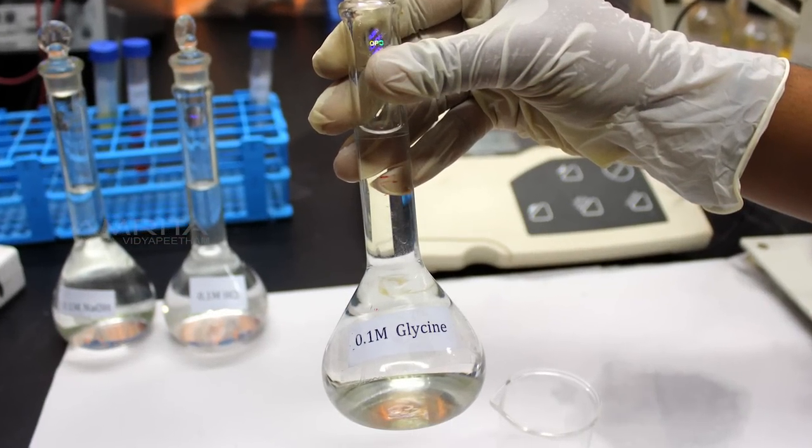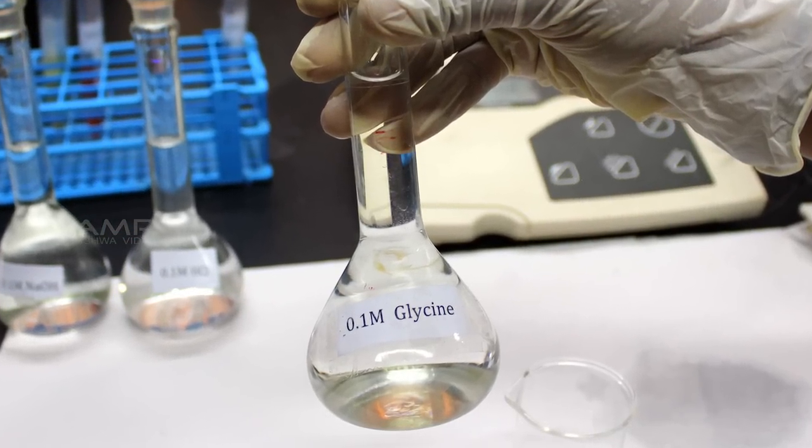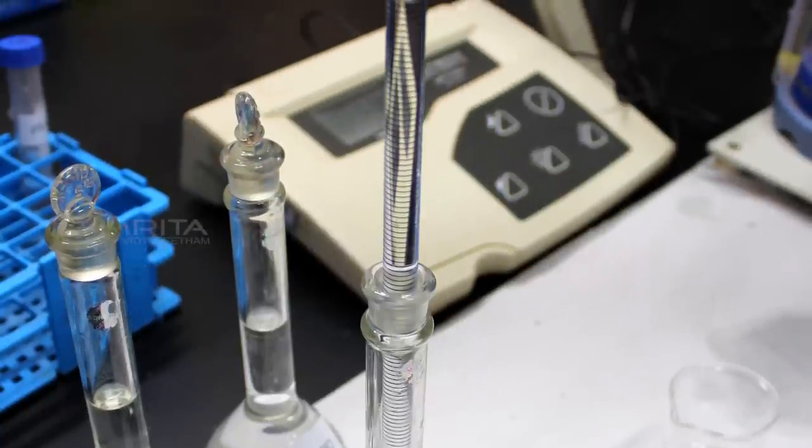In this experiment, we will plot the titration curve of glycine and thereby calculate the pKa values of this amino acid.